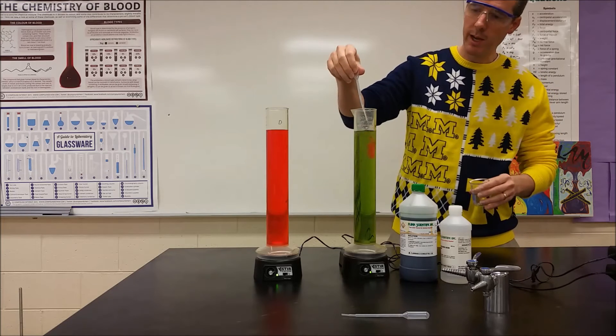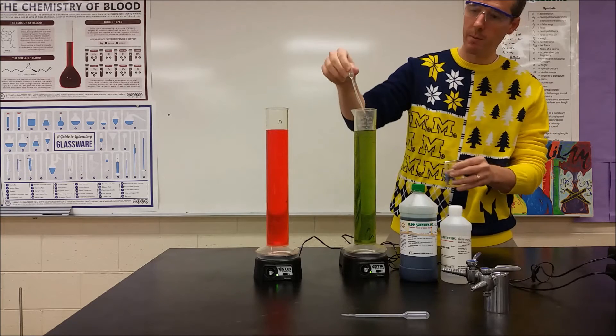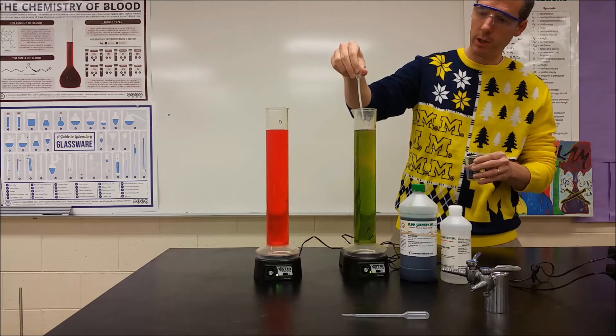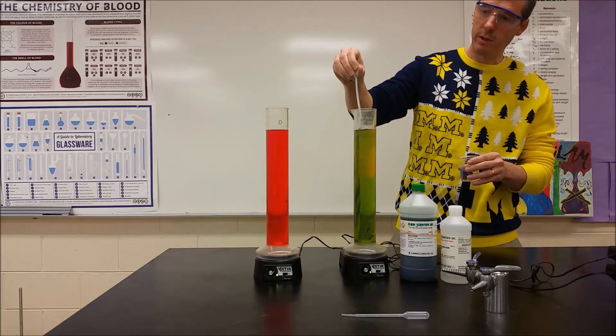So we are changing pH, but it's taking some time to get there. It's taking some acid to get there. So we're going to speed this up just to show that it will eventually change. We're adding about two, two and a half milliliters at a time now.